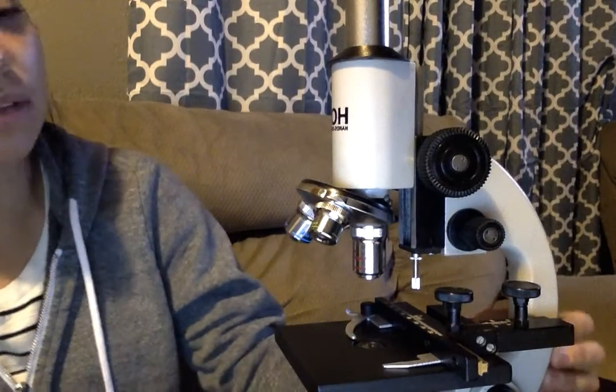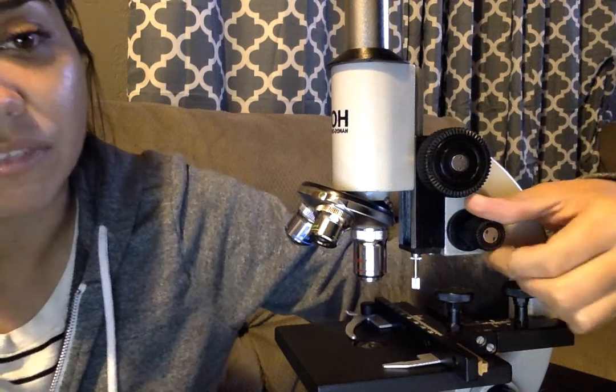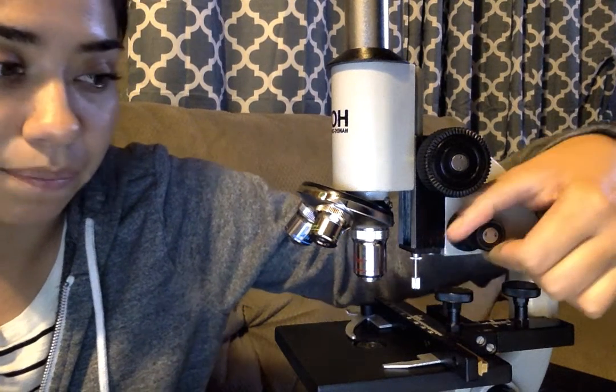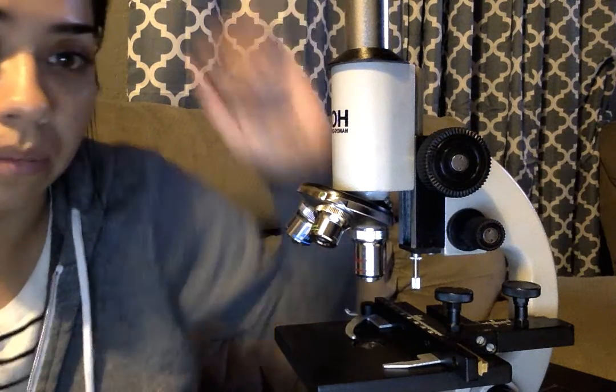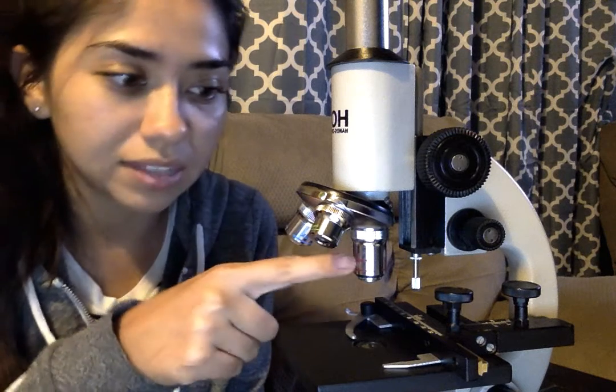In this video I'm going to go over the first exercise, which was going over the various components of our microscope. The first part is the ocular lens up here — the ocular magnification is dependent on the microscope and varies per microscope; mine is 15. Below that we have the arm of the microscope. This big knob is the coarse focus knob, which allows me to move the stage up and down. Here we have the fine focus knob, which allows me to adjust the focus of the image. Up here is the turret, which has three different objective lenses: the smallest is called scanning, the medium one is the low lens, and the largest is the high lens.